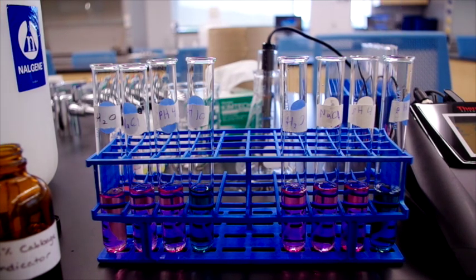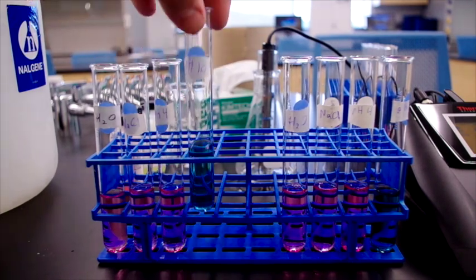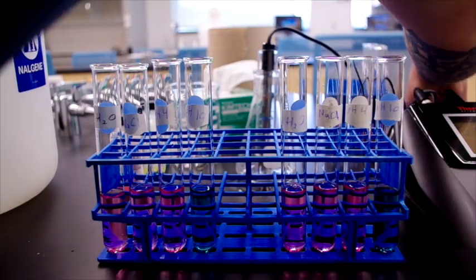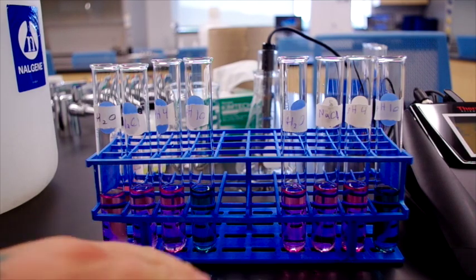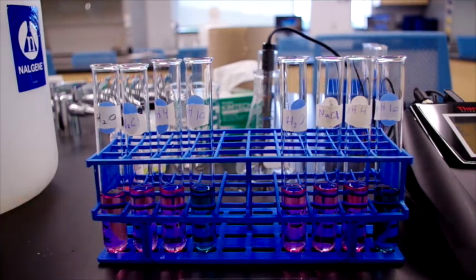So now we've established that our initial solutions, which should be first 2 neutral, low pH should be slightly acidic, and high pH should be basic, according to our card that we consulted at the beginning, which we will include in the lab report. You can see the pH is roughly accurate.